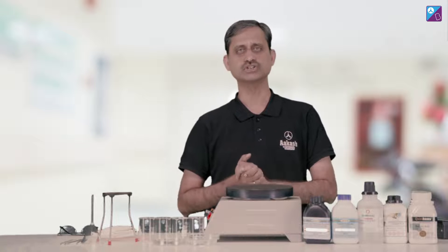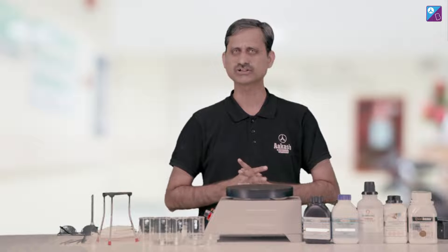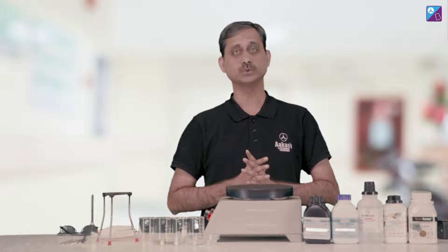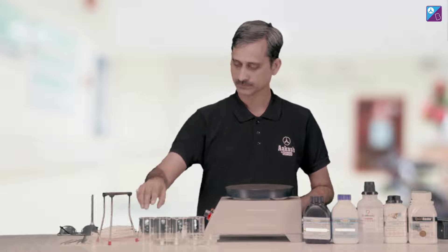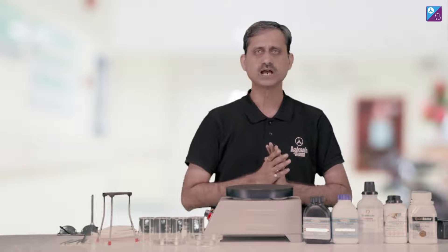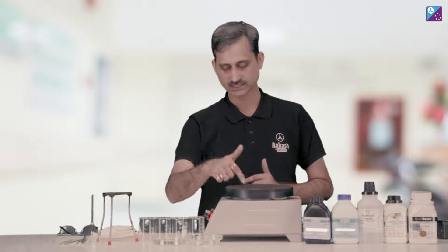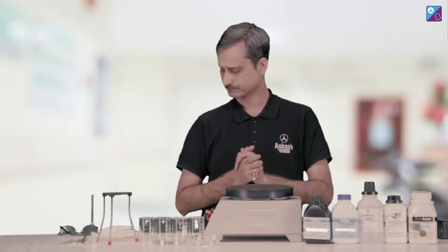These are the filter papers, which we need for filtration, so that if there are any particles — because crystallization is actually a purification technique — we need the filter paper. These are beakers, these are petri dishes, in which we are going to create crystals. This is our hot plate, which we will use to heat up the system to create the solutions.